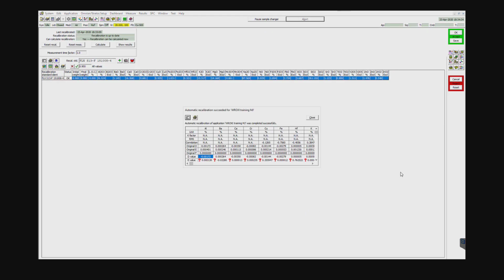Once the measurement has been completed, you'll be populated with an automatic recalibration succeeded for WROXI window here. And I can go ahead and look at my original E value, and now I can see the E value with a question mark, which means that that's the one that has been calculated. There's nothing really else to do here. You can go ahead and just do a comparison if you wish, and then go ahead and close the window. There's nothing to do. The recalibration has already been done.